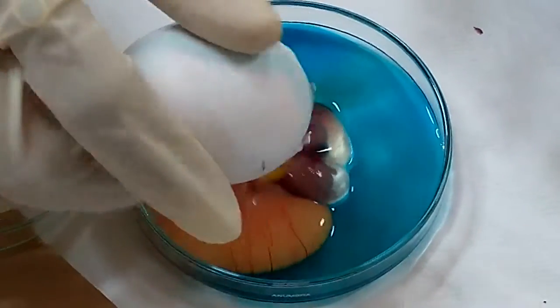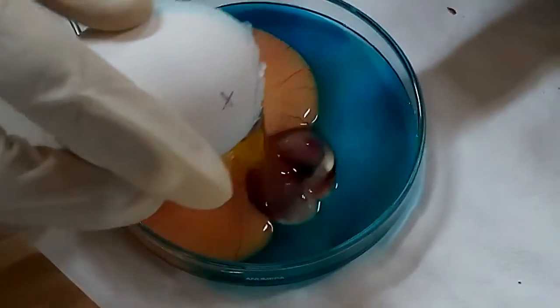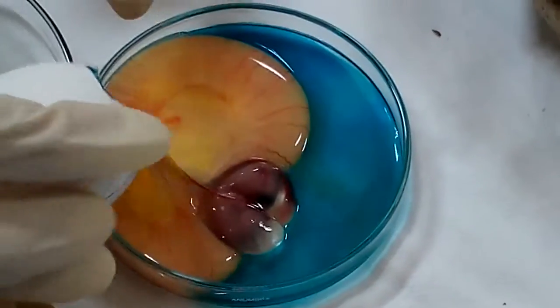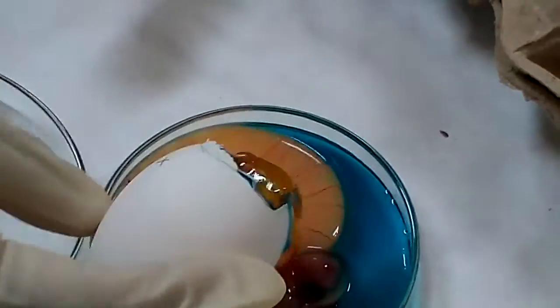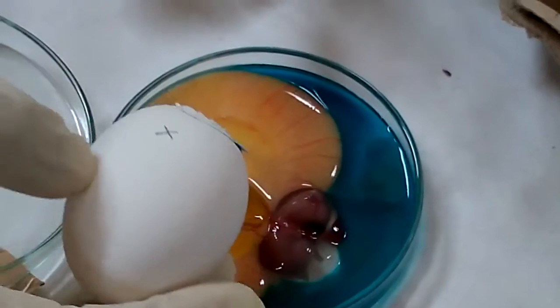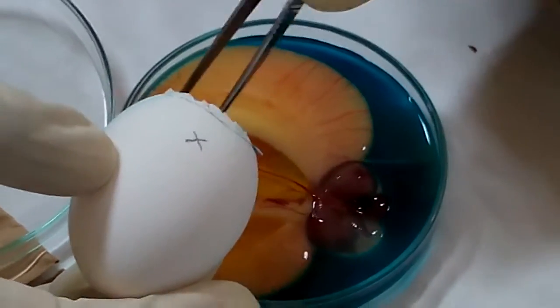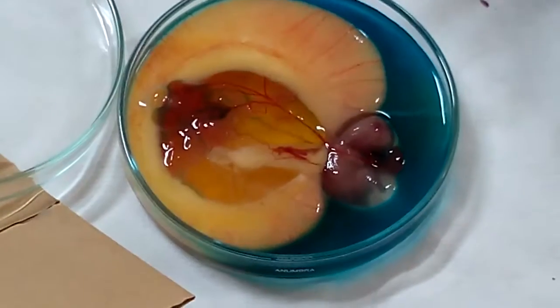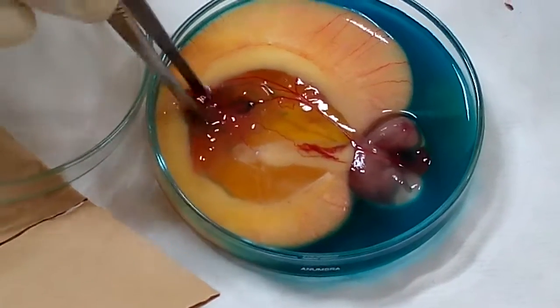Now the last thing we take out: this thick layer is albumin — a proteinaceous part. And then slowly you can see, all of you, that this chorioallantoic type membrane is coming out. So this is the chorioallantoic type membrane — this is the membrane which has come out.